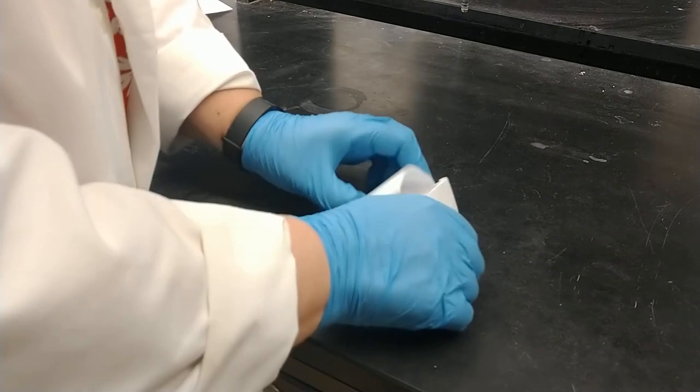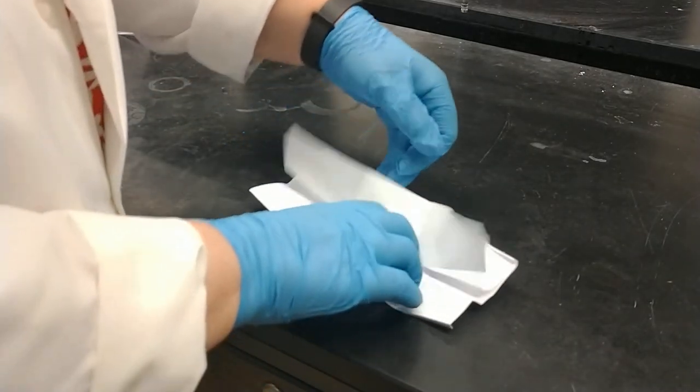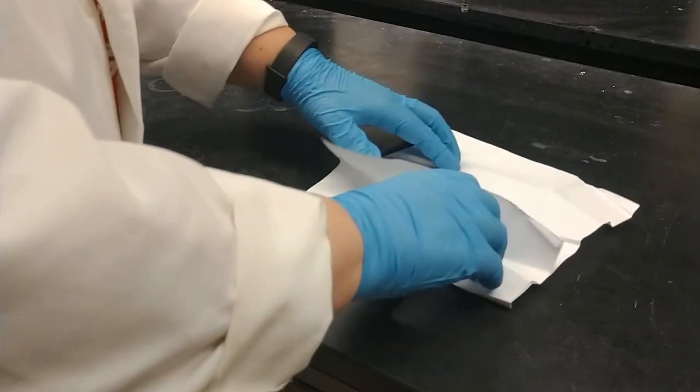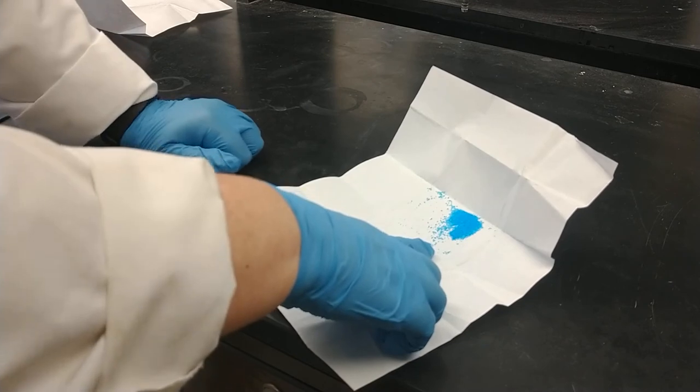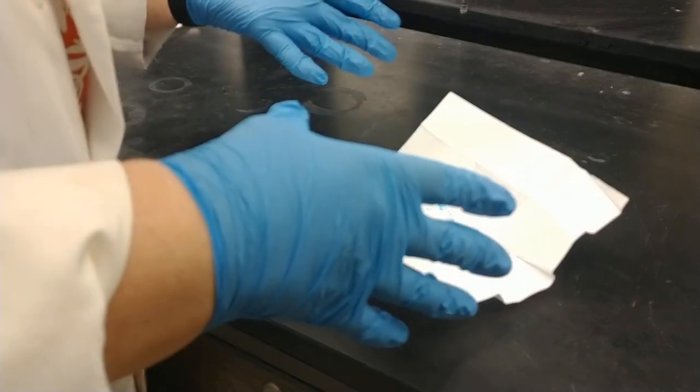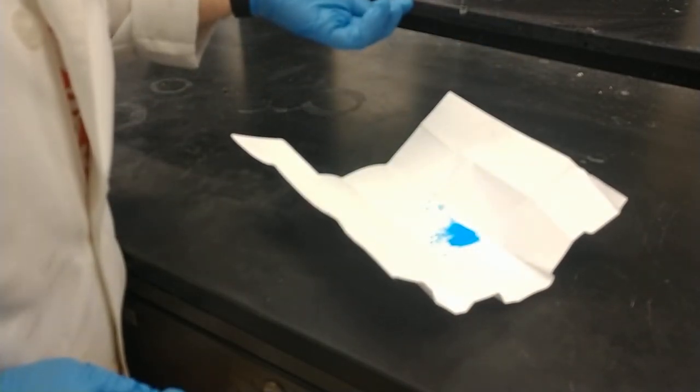And you can see that when the analyst gets to open it back up, the material is pretty much exclusively in that one corner. So I'm not losing all my evidence to being stuck in plastic bags or stuck all over the place. It's very easy for me to now collect this and do an analysis on it.